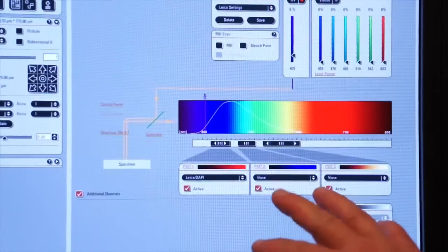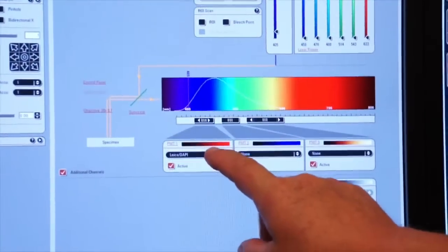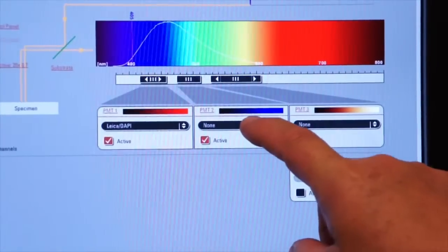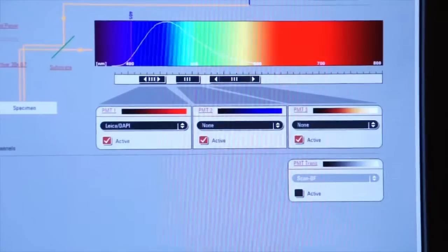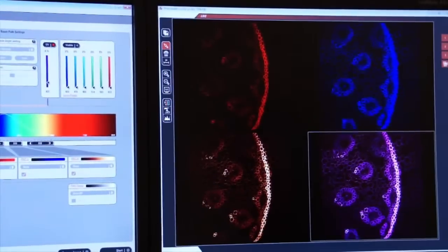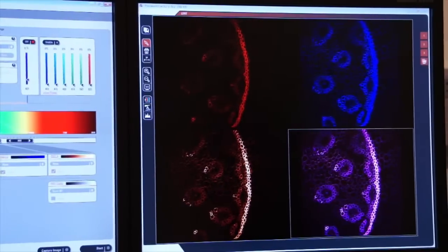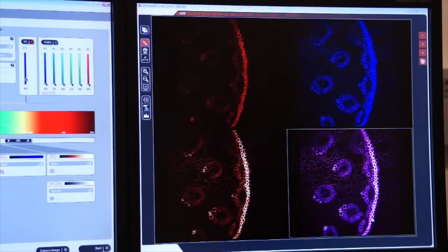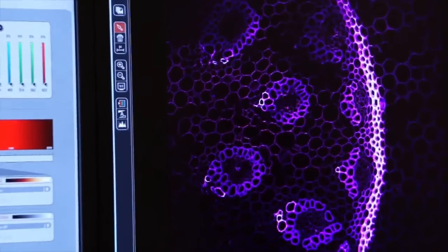So let's see what this looks like on our output. We've selected red for the first PMT, blue for the second PMT, and glow dark for the 3rd PMT. If I click on live, you'll now see the image on the right hand screen. Here are my 3 PMTs all looking under that one excitation curve, and here is my composite image showing me all of the light combined into one image.